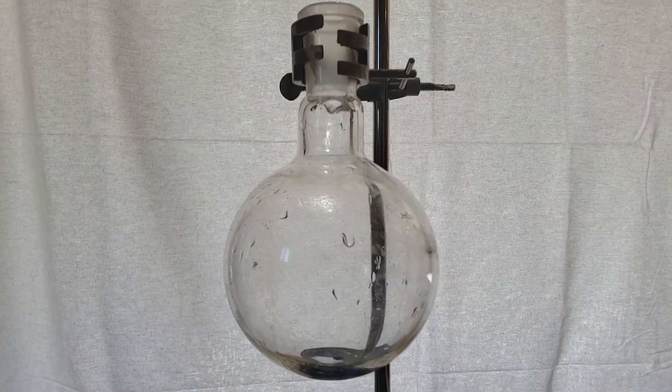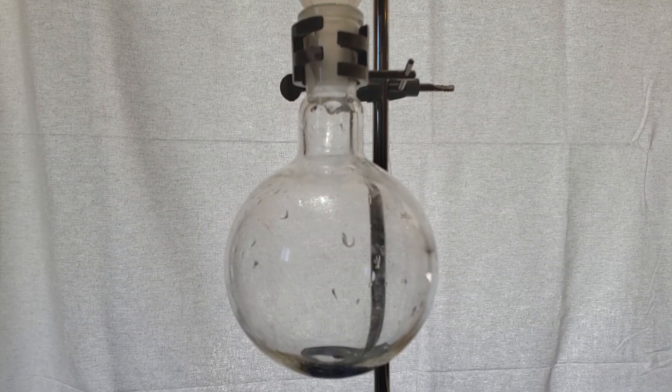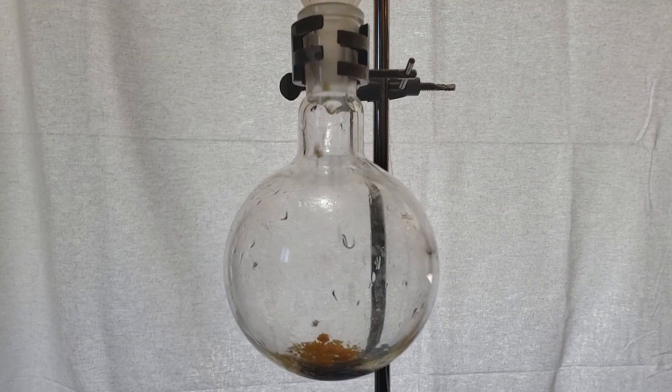I zested the orange peel off of three whole navel oranges. I loaded the zested orange peels into a 500ml round bottom flask.